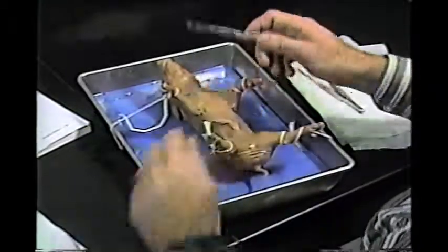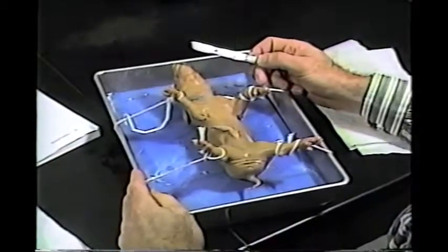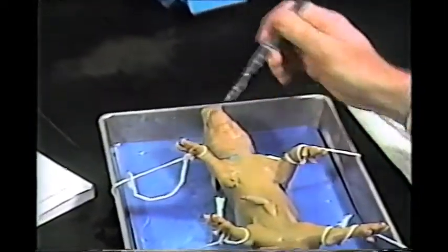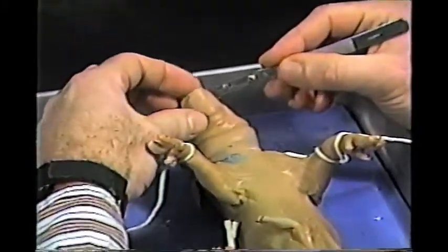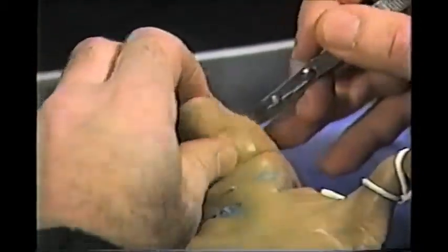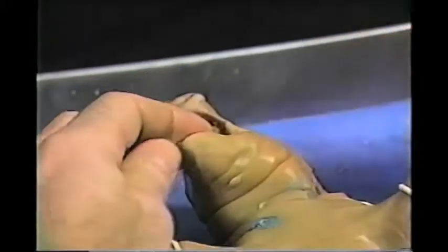Now we're going to take our scalpel. Be careful of these scalpels because they're very sharp. They may not seem that sharp until your finger gets in the way, and then you'll see. We're going to open up the jaw of the fetal pig and slice downward on either side. Be careful when you put your finger in here to open it up, because there are little teeth that you may find out are still sharp. Now, since the fetal pig is primarily cartilage, we can cut through the jaw without much of a problem. And I'm just going to turn this a little bit to cut the other side.